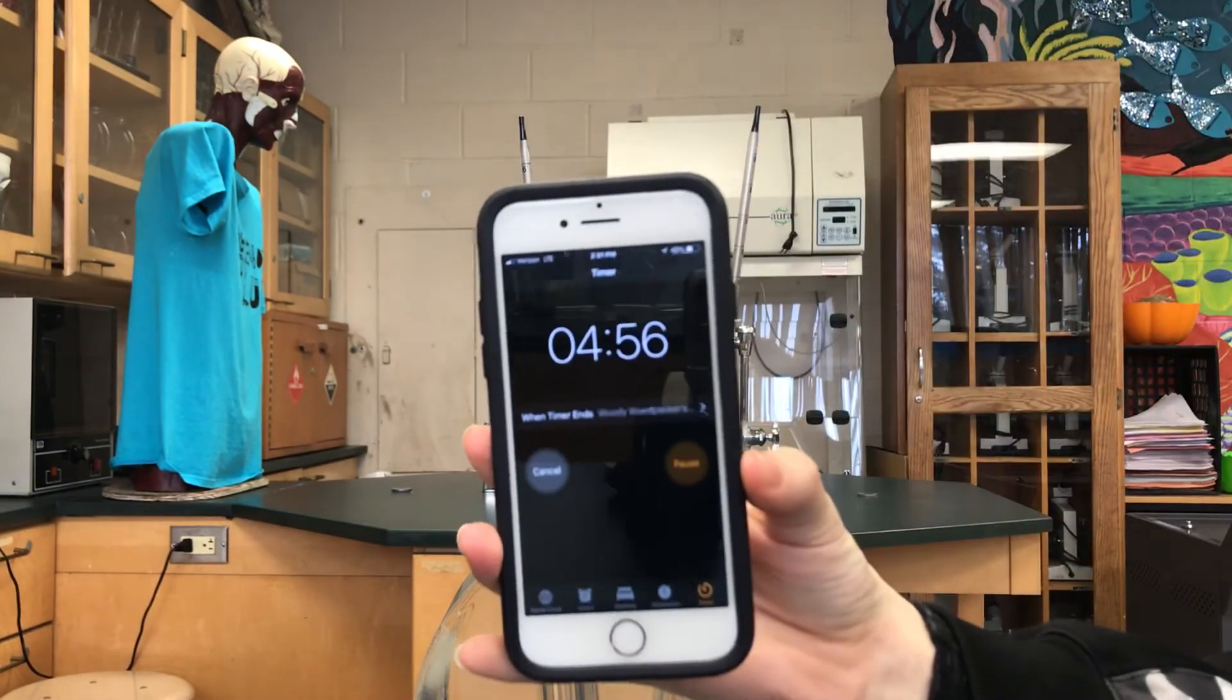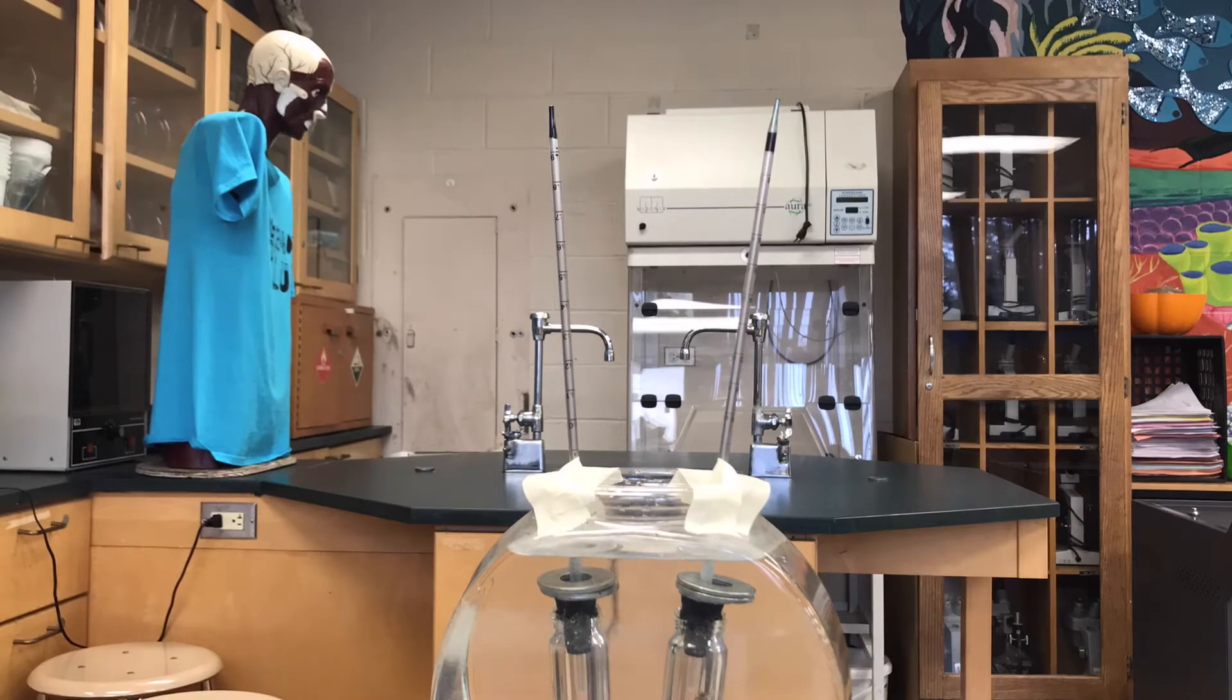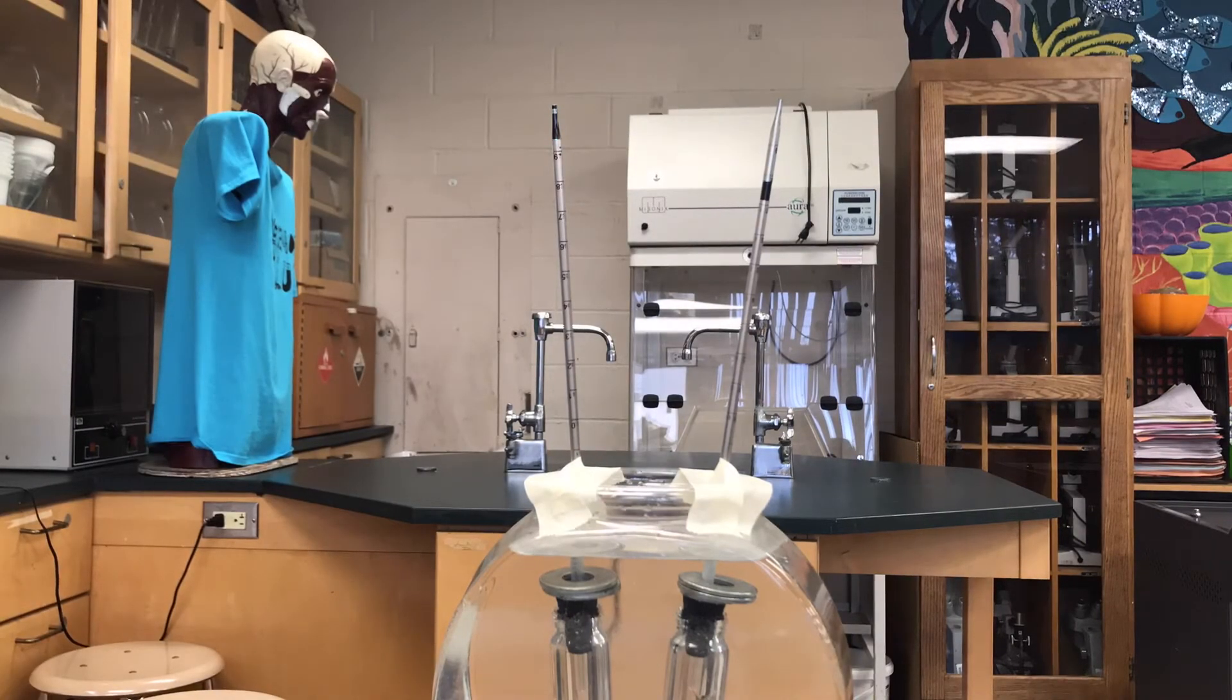It's important to record the movement of the dye every 5 minutes for a total of 20 minutes. As you can see, the pipette on the right side has the crickets inside which is moving towards the chambers. This concludes that the oxygen intake is being recorded.